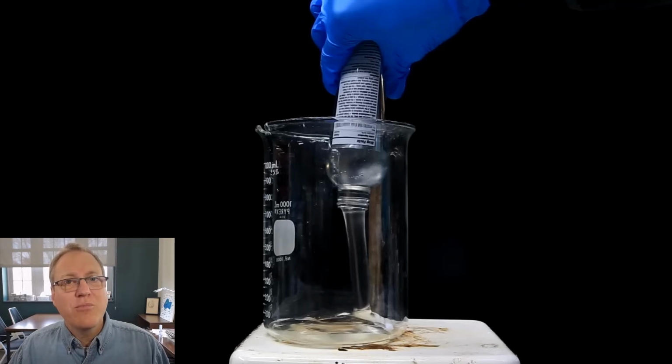And I will note that there is a chip on this beaker. Try to avoid using chipped glassware. Listen, I do it all the time, but generally you can cut yourself and stuff. But you will almost never see NileRed use chipped glassware. I guarantee you in his new videos, he uses nice, pristine stuff. But there is a chip in that beaker.